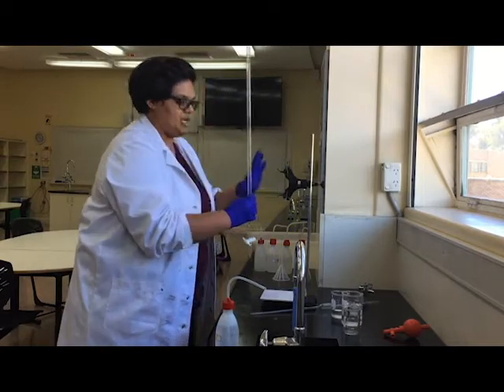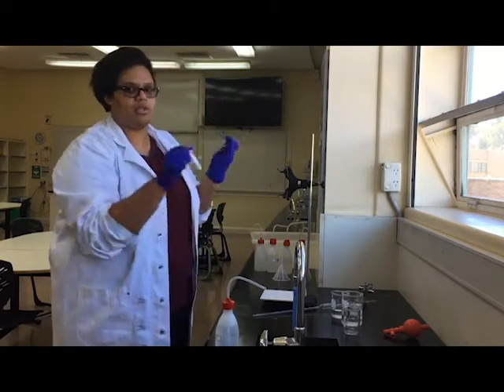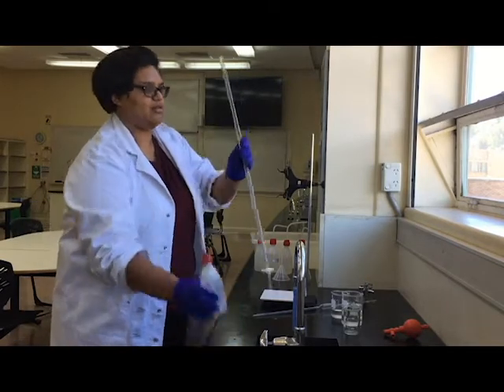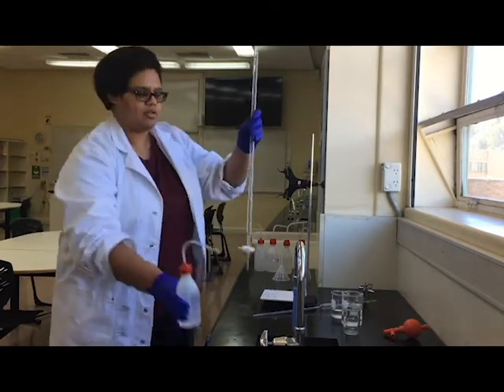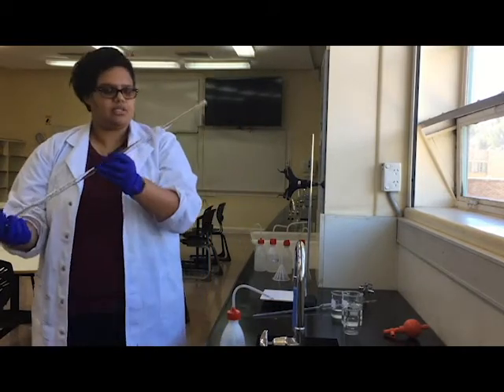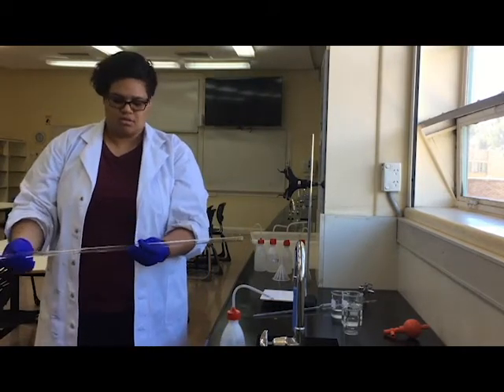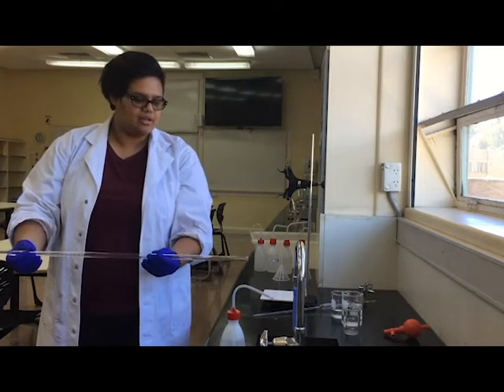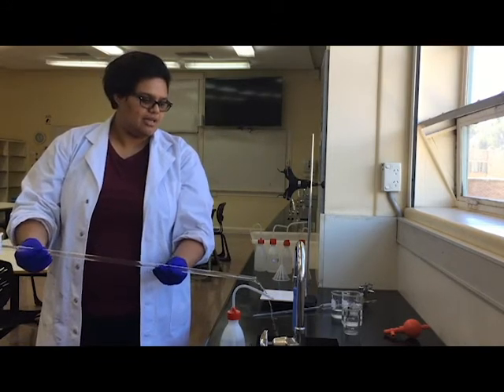I'm going to wash our burette. With washing the burette, I'm going to make sure that the stopcock is closed so that water can't come out. I'm going to put some water inside, then turn it around and twirl it, twist it towards the sink. Keep twirling it, and that coats the inside of it and gets out any contaminants that might be in there.